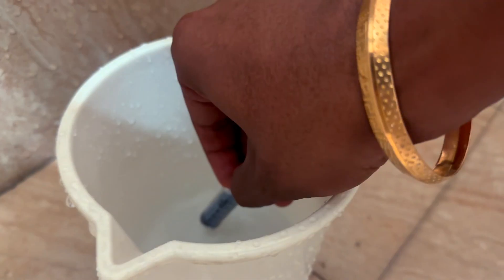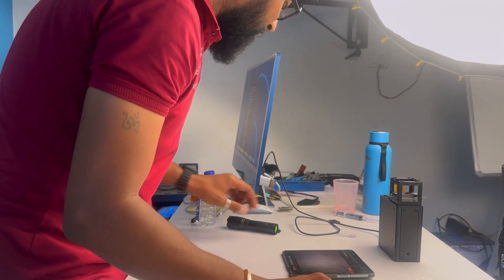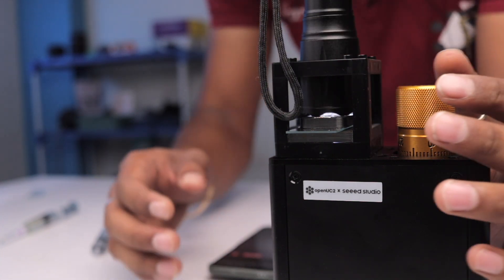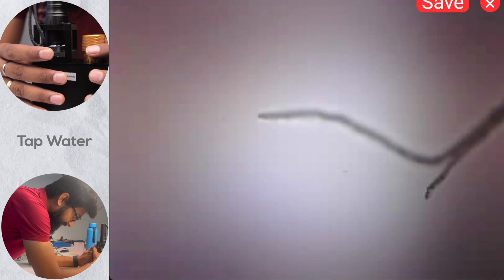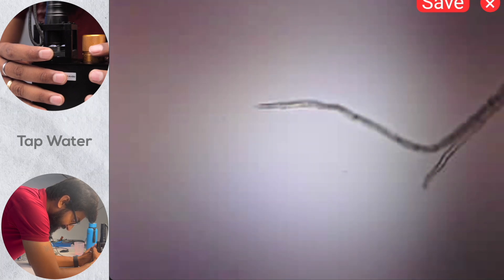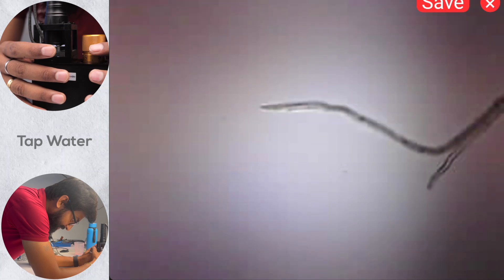Next, I went home and collected a sample of the tap water from my home. After adding the sample to the slide, turning on the torch, and placing it on the microscope, I found a very weird-looking thing inside the tap water. It doesn't seem to be moving, so it's not a live organism, but it's really strange — it looks like a thread.